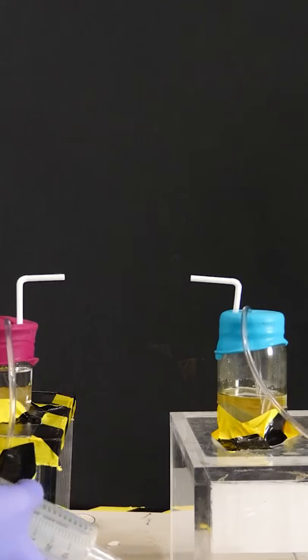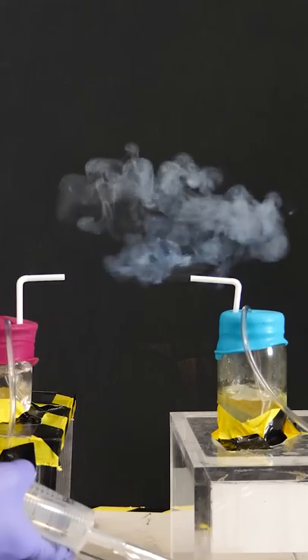On the right, I have air that contains hydrochloric acid vapor in it, and on the left, I have air that contains ammonia gas in it.